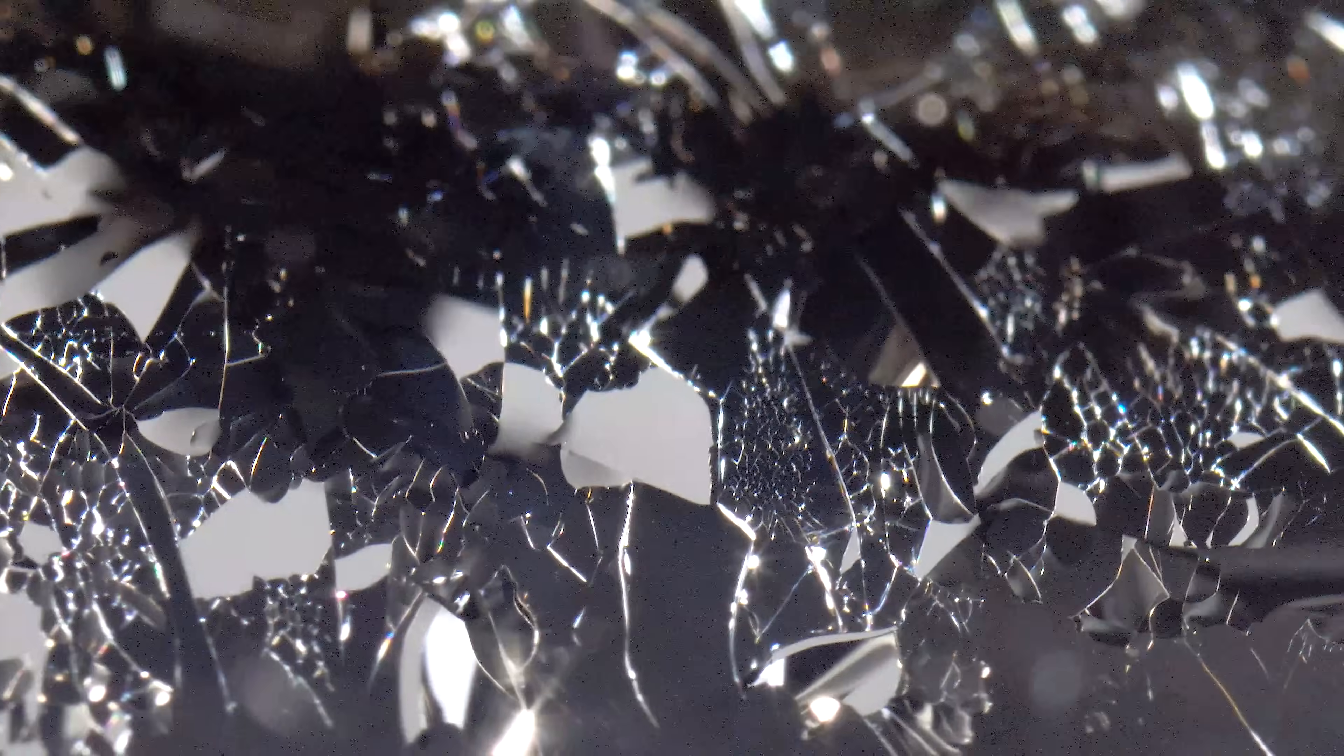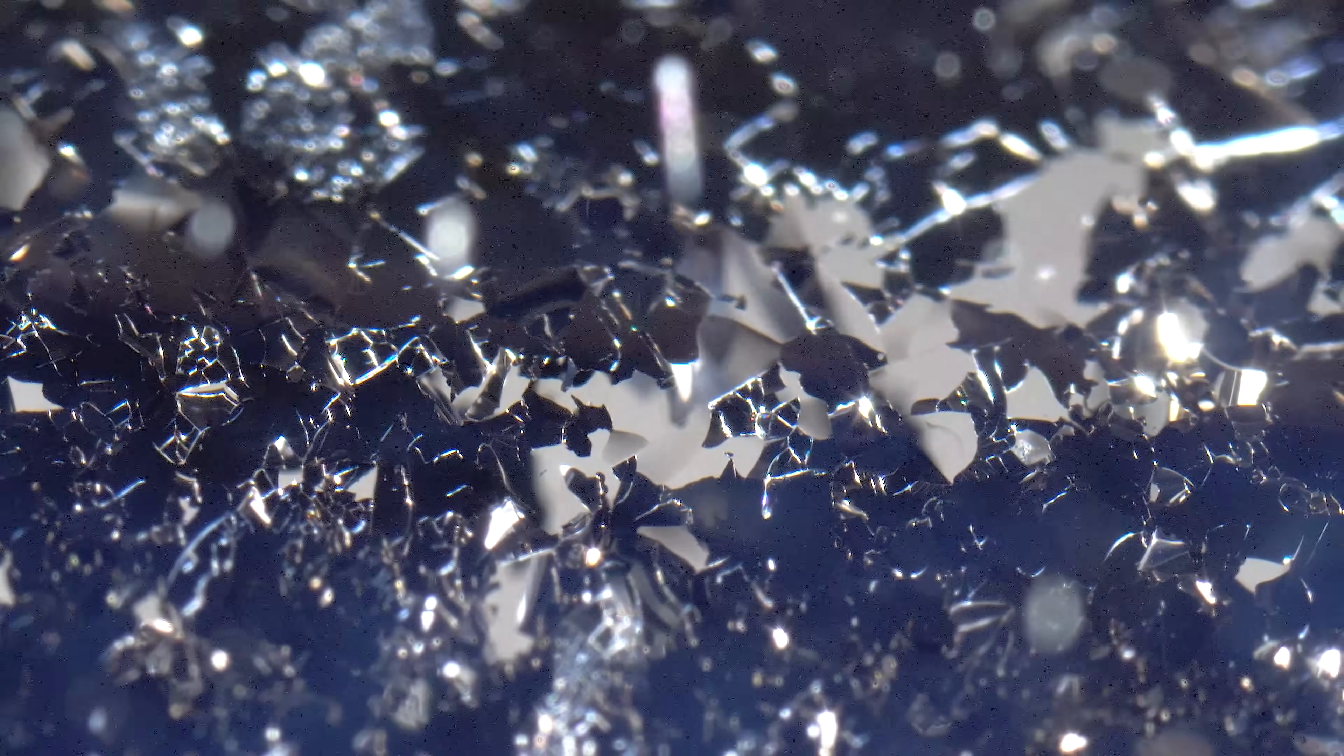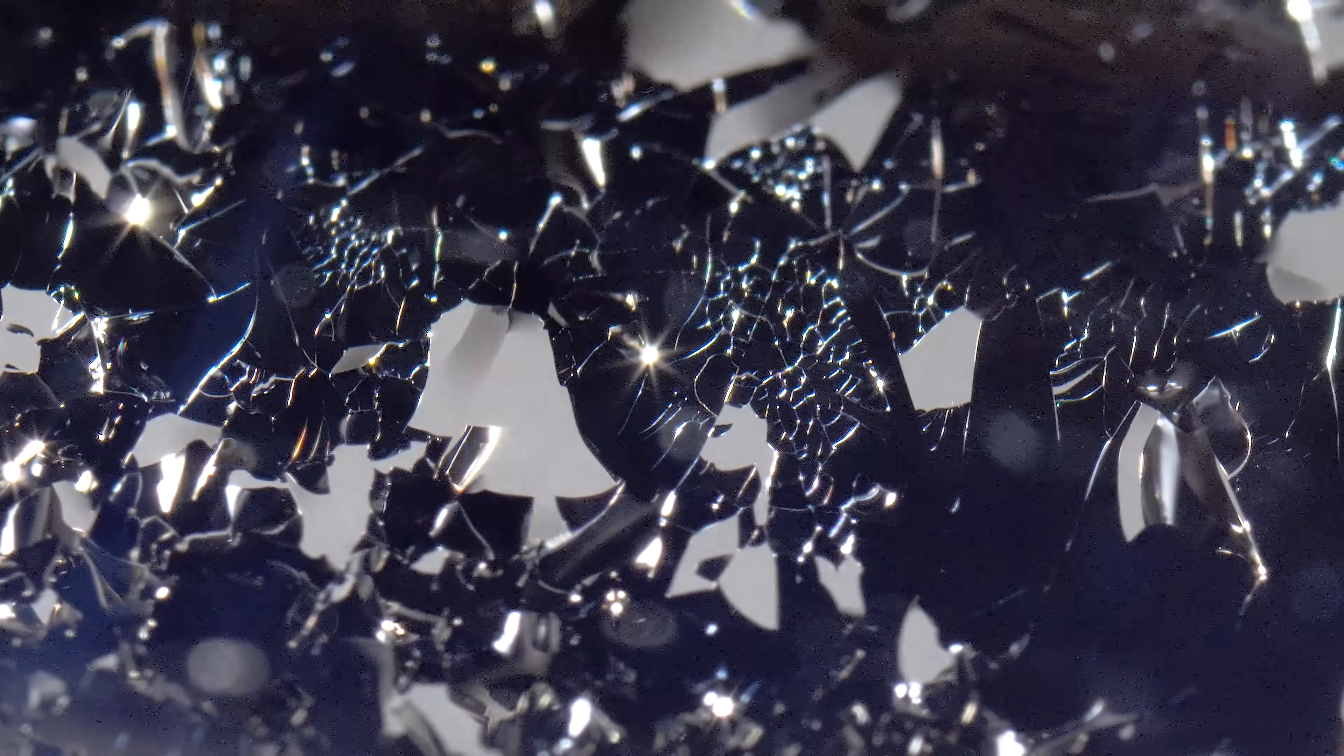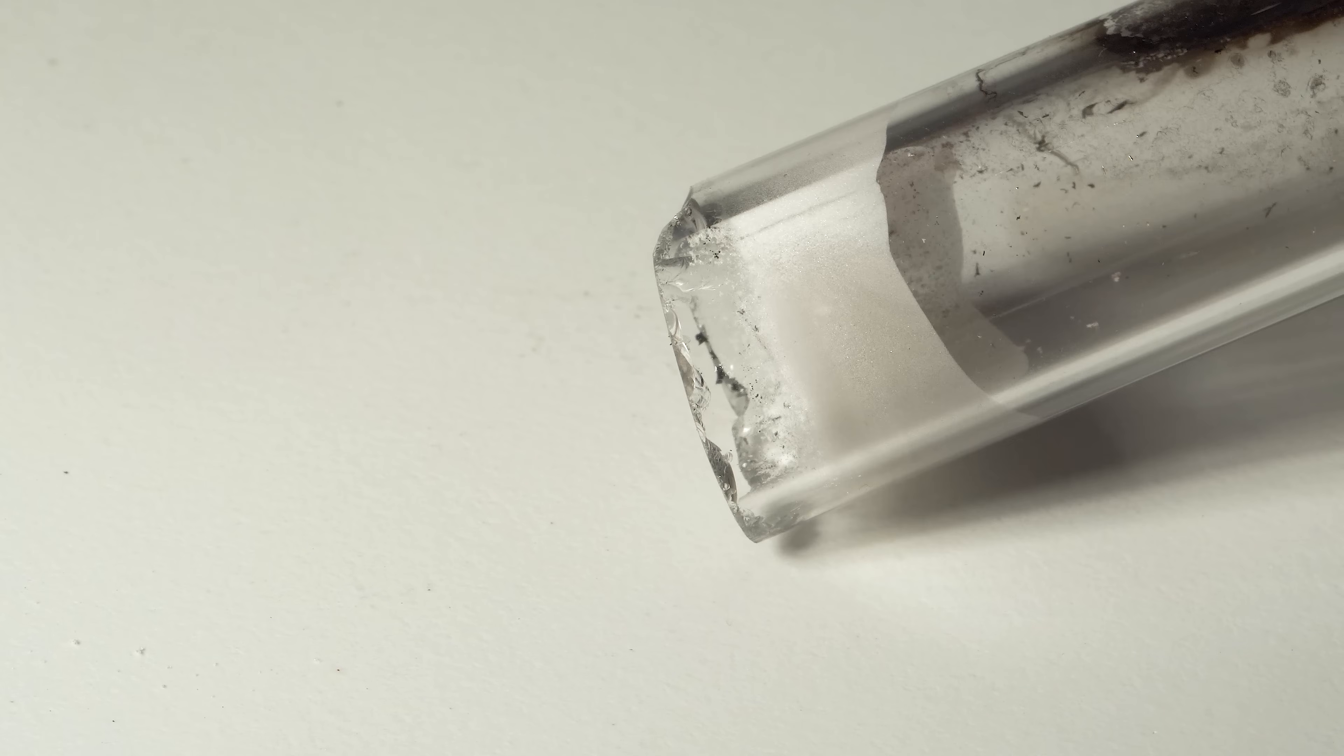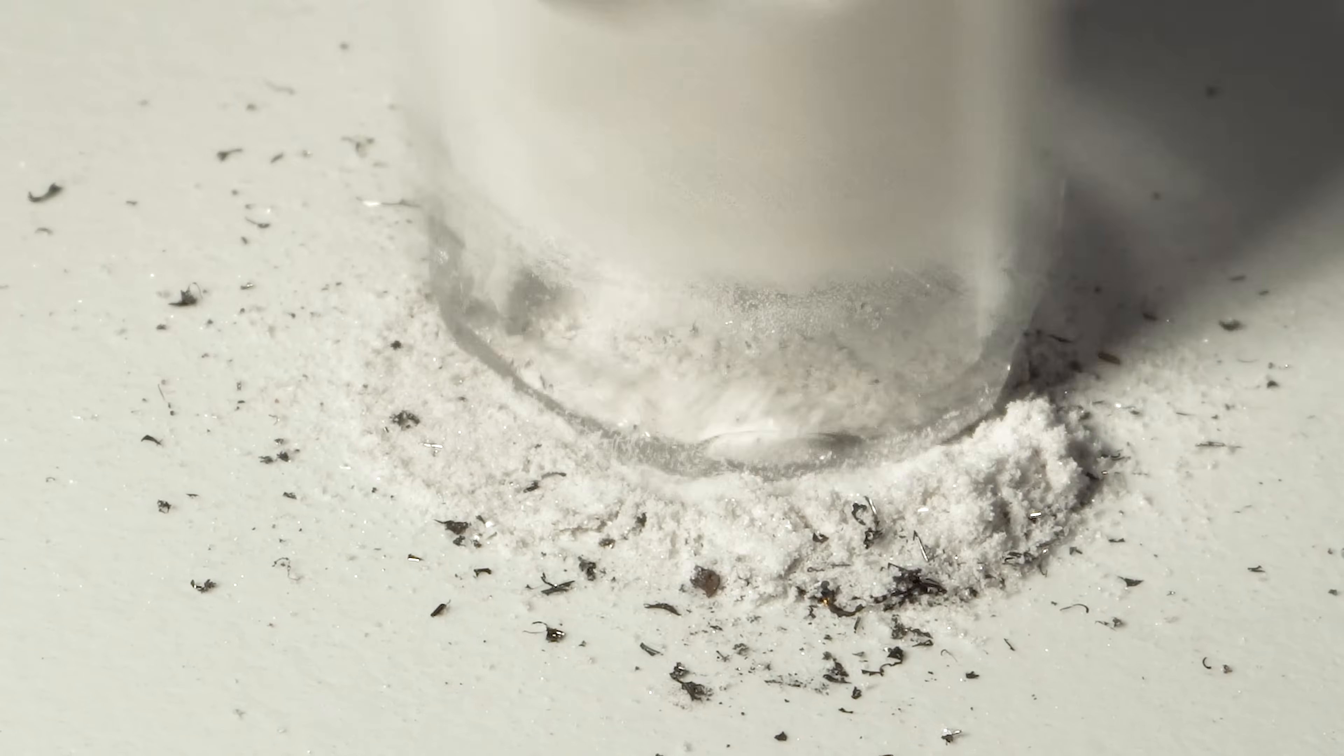In these close-up shots, you can clearly see the places where the tungsten exfoliated during deposition on the glass surface. A white powder has also settled on the cooler section of this tube, which is sublimated tungsten hexacarbonyl. This is how the substance should ideally appear.